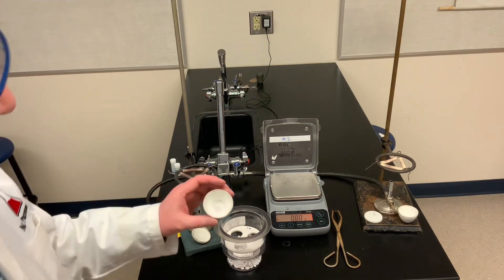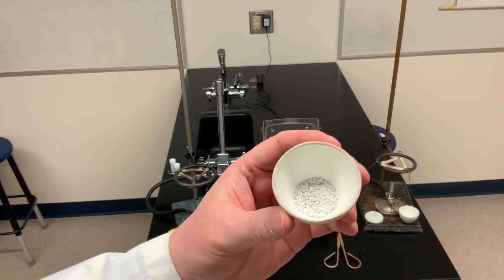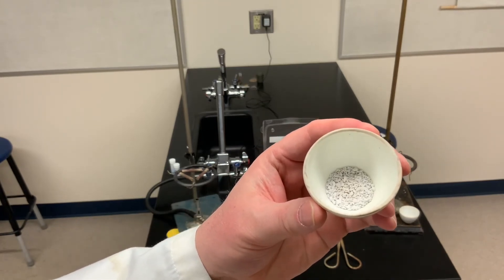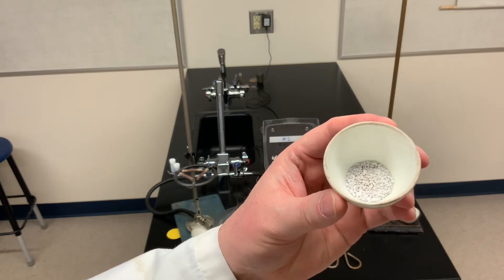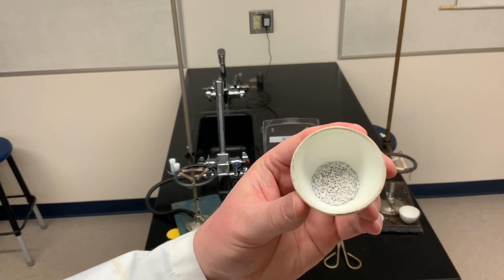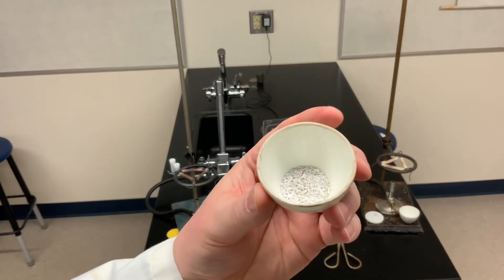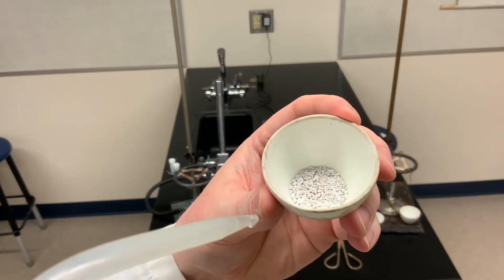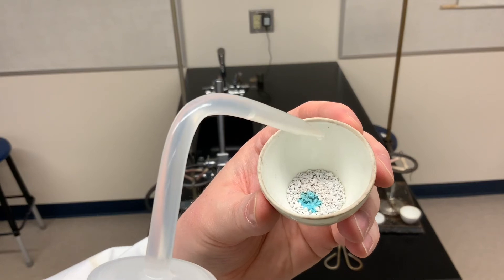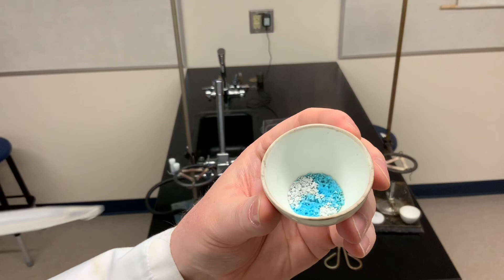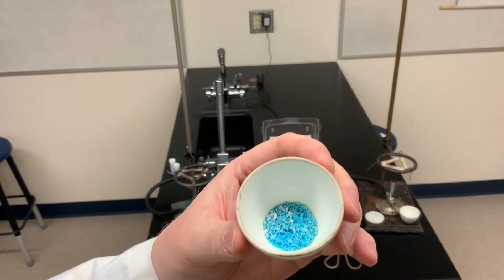Now I've got my first crucible here and I'm going to show you something before we finish. So there's the white salt, the anhydrous copper sulfate after we drove off the water. Now to drive off the water, we needed to heat it. So driving off the water, turning it from the hydrated salt to the anhydrous salt must have been an endothermic process. It absorbed heat from the burner flame to do that. I'm going to take some distilled water. I'm going to put some distilled water into the crucible. And I want you to make at least two observations as I add the water back to the anhydrous salt. So see if you can make two observations. Now one of those observations should be more obvious than the other, but I think you probably detected both of them.